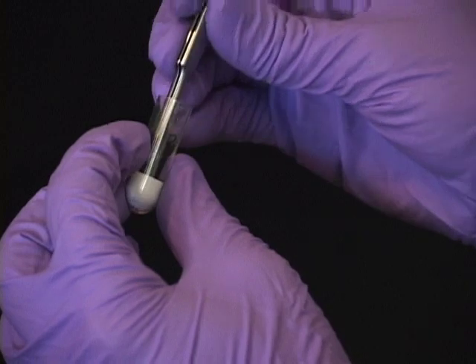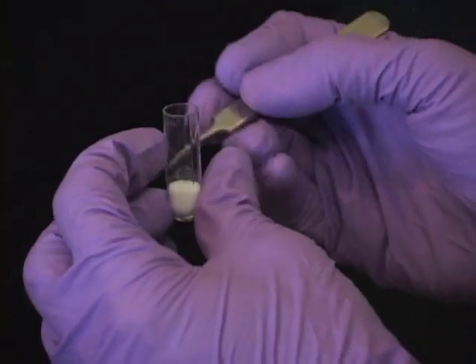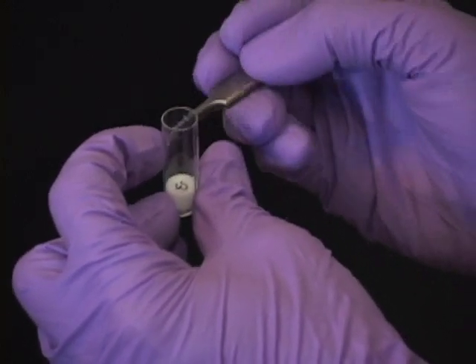Alternatively, gently turn over the coverslip with your forceps and knock the side of the tube until it lays flat.